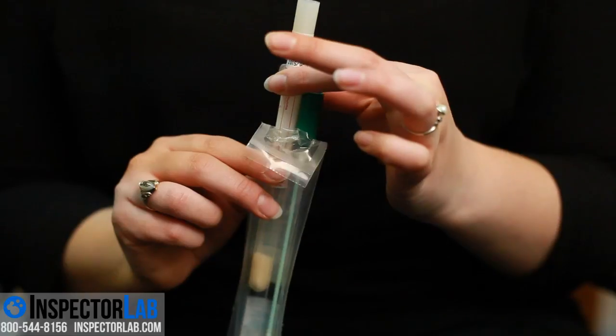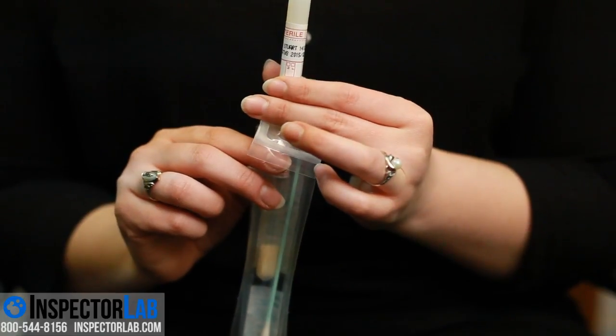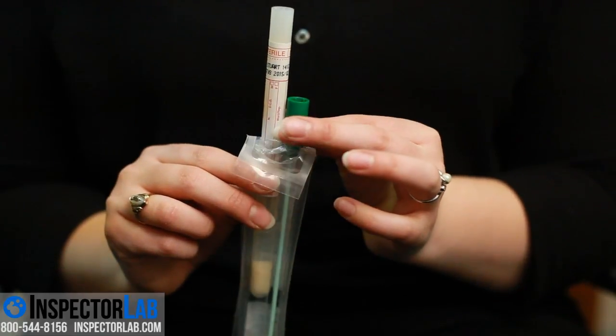To begin taking a swab sample, make sure your clothes and hands are dust free. Make sure to never touch the white fabric tip of the swab.